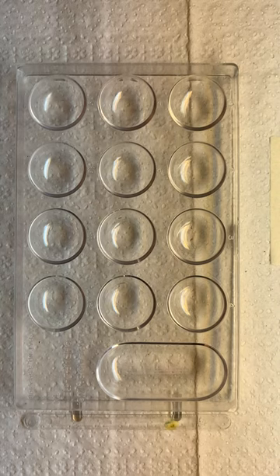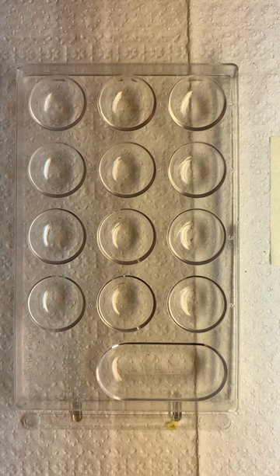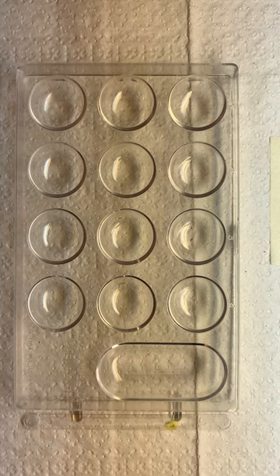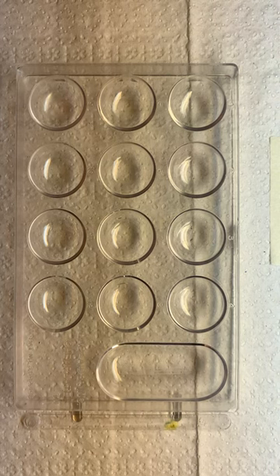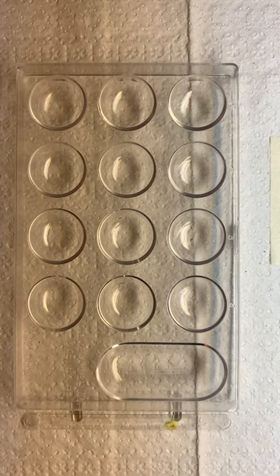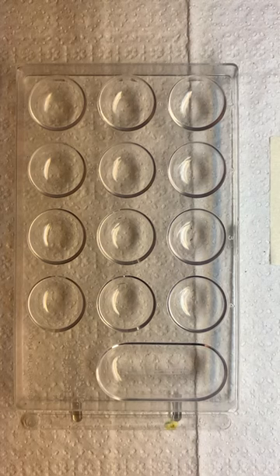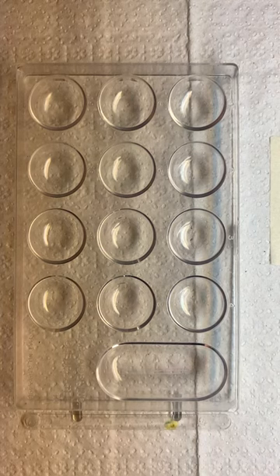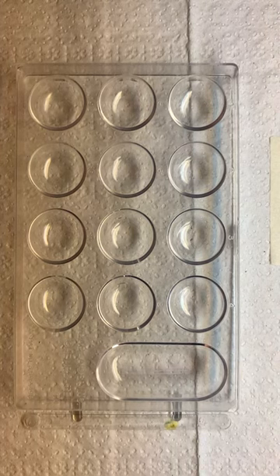Okay, we've seen methyl orange change to red in the presence of an acid between pH 1 and 3. We've seen bromthymol change to yellow in the presence of an acid between pH 1 and 5, so it changed at 1, 3, and 5.